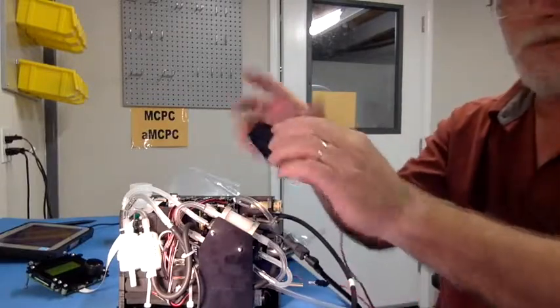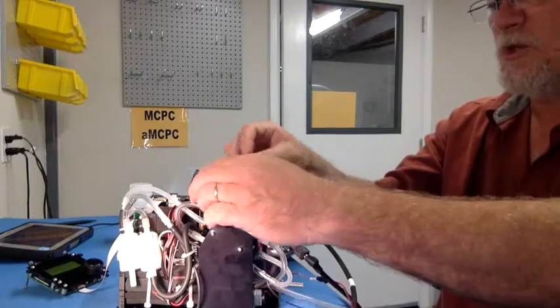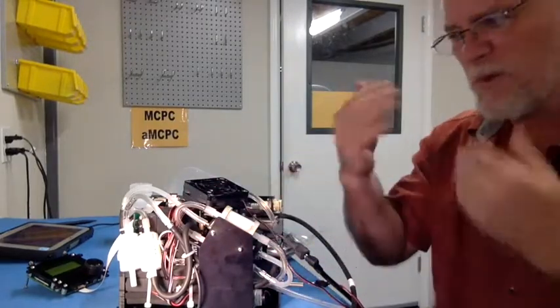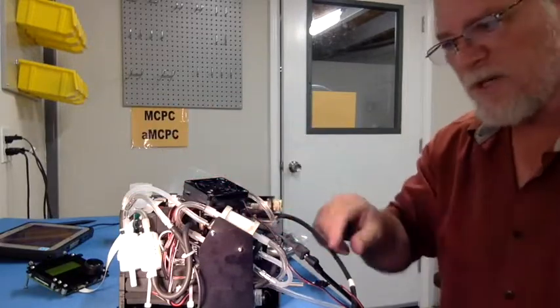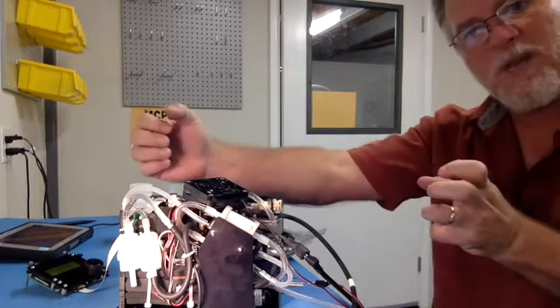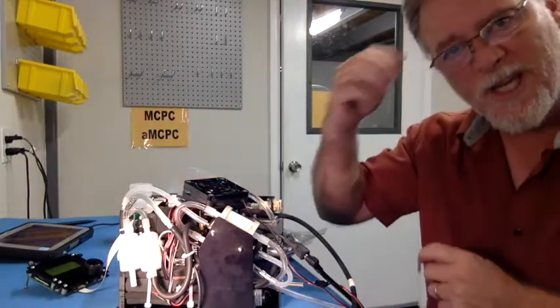And what you want to do temporarily is you can use this to simply blow cool air on the condenser assembly inside, because we want to evacuate that hot air that's being generated by the saturator that's kept at 45°, and the hot air that's being rejected by the coolers on the condenser.